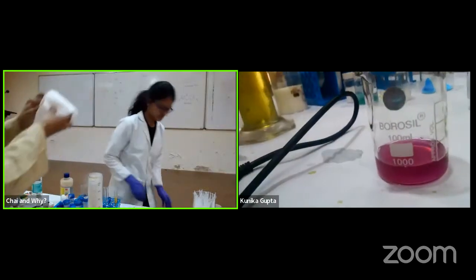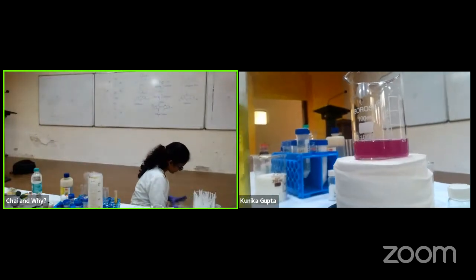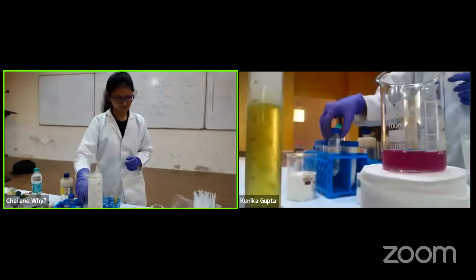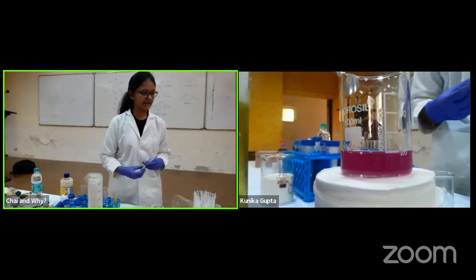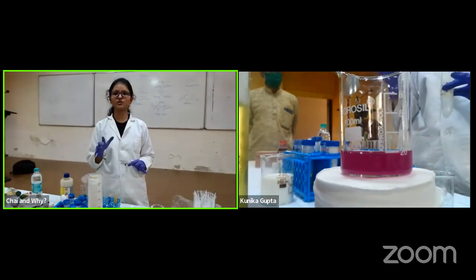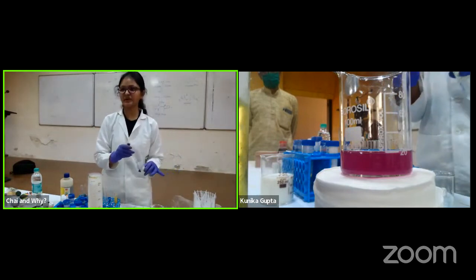That is very easy. I don't know what happened, but first make it alkaline. Okay, one sec. Let me get this one. So you have cabbage water, and you can make it alkaline. For alkaline I am using sodium hydroxide. At home you will have baking soda or something, or dish detergent, soap powder. I'll show you an experiment with that as well.